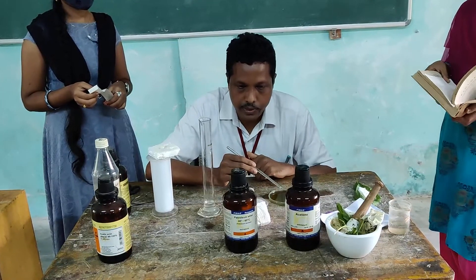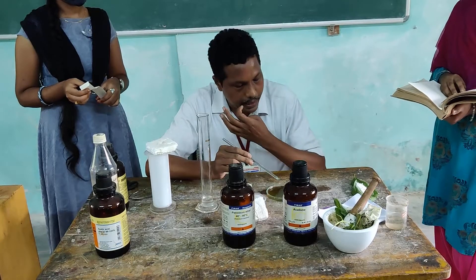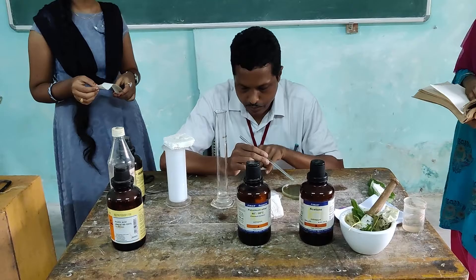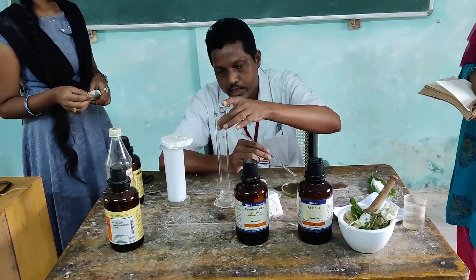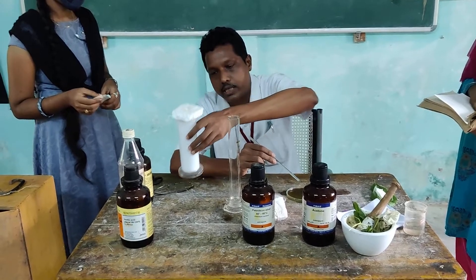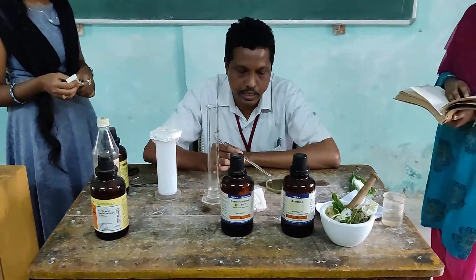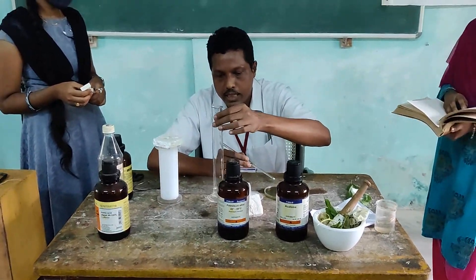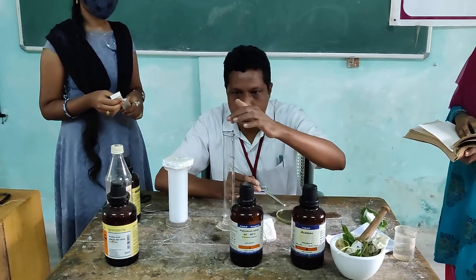The chromatography paper is used in the process. We need to make a measuring jar ready. We have to go to a measuring jar and make the ratio to scale.